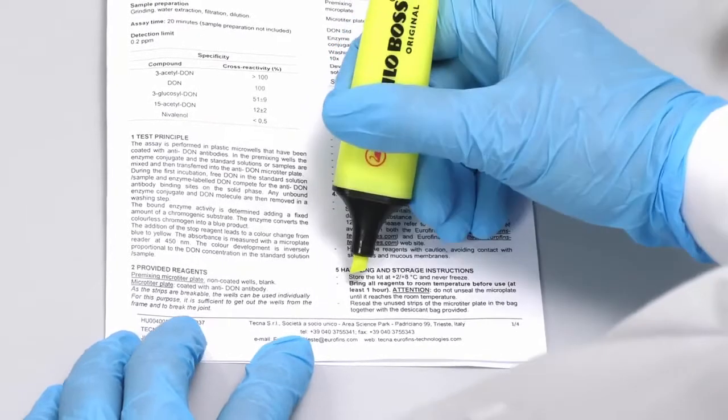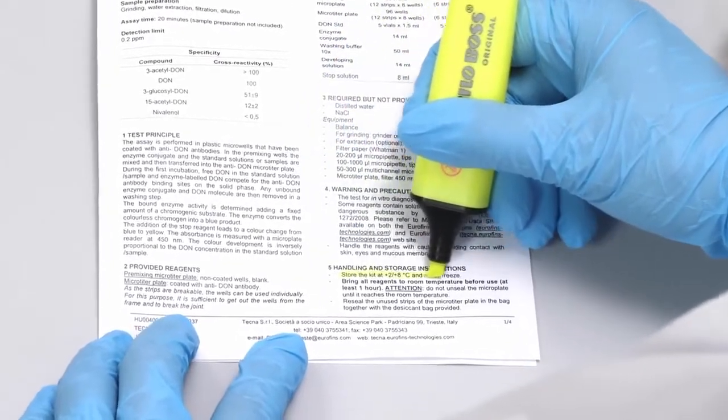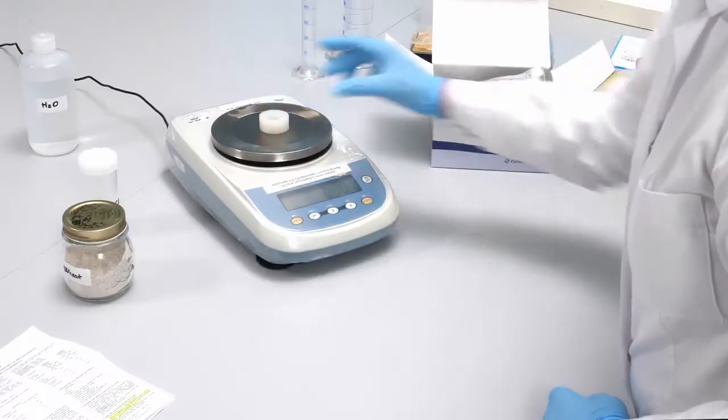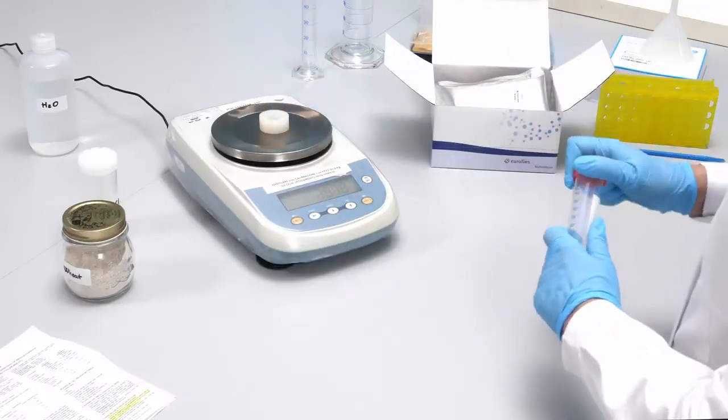Read carefully the instructions before running the analysis. Follow the procedure indicated for the matrix type you want to analyze.